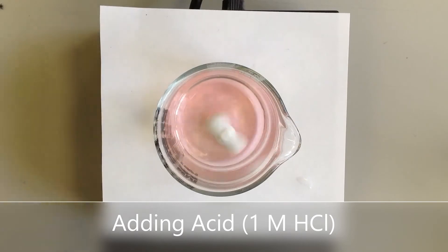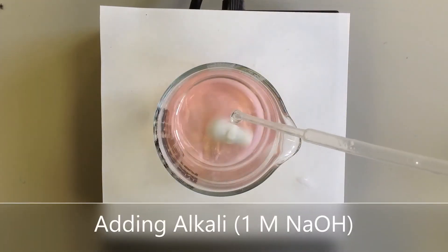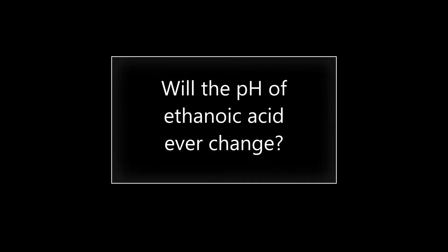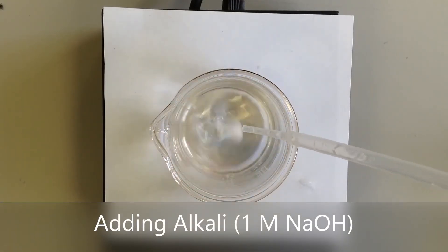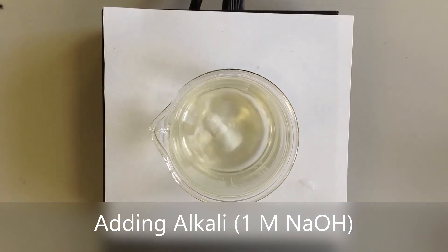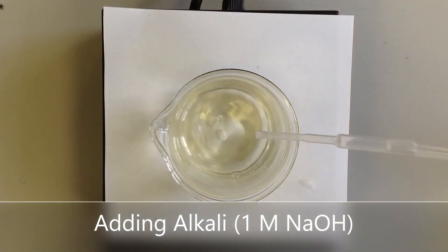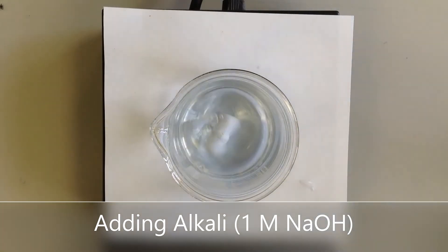And it's really going very, very quickly in one direction or the other. It's not magic — if I add lots of NaOH, it does eventually become alkaline. But it's absorbing a lot more sodium hydroxide than it would in the case of a strong acid with a similar starting pH.